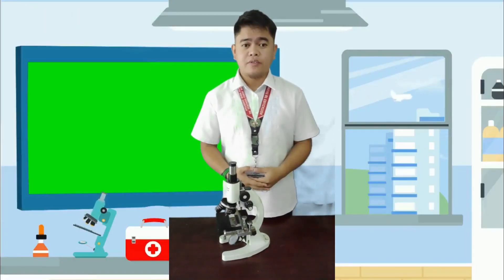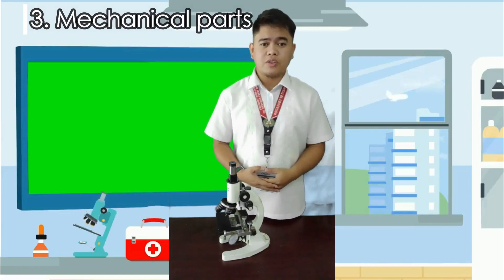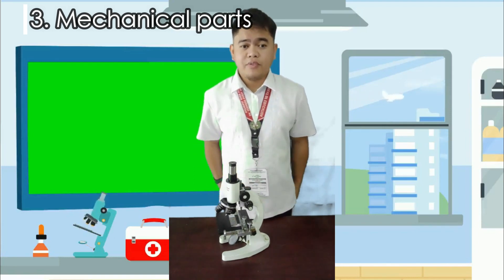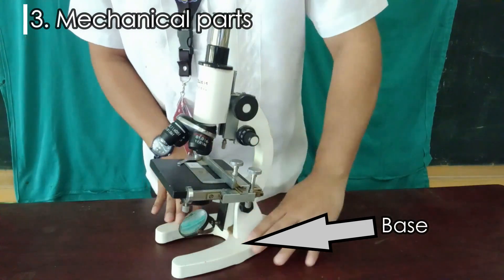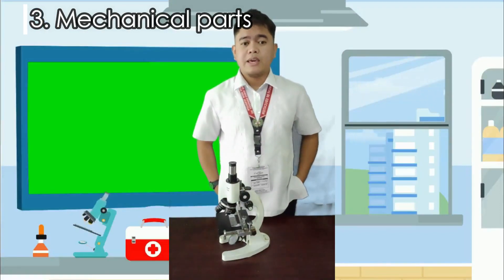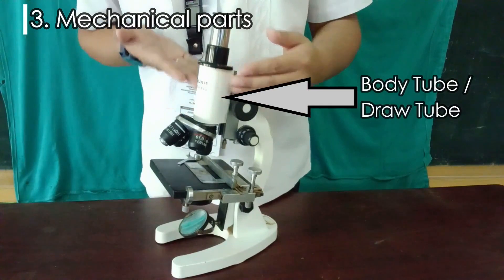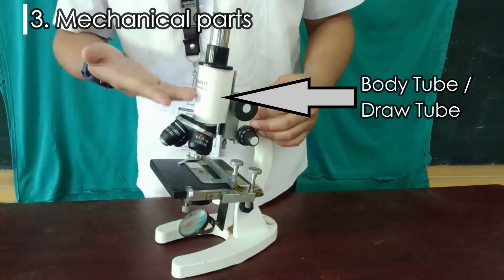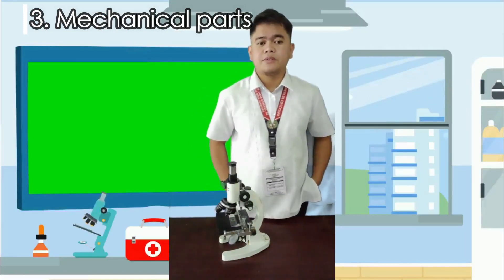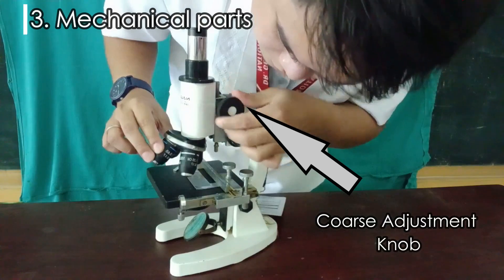Mechanical parts of the compound microscope are used to support and adjust other parts. We have the base, which provides support to the microscope. The body tube or draw tube separates the objective and the eyepiece and maintains continuous alignment of the optics. The coarse adjustment knob allows movement of the tube upwards and downwards.